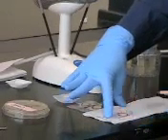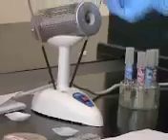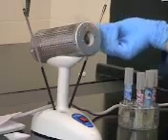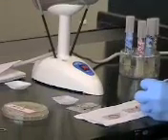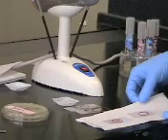Then you're going to want to take your grease pencil and draw a big circle on them. Pretty thick. This will help you find your bacteria once they're stained in the microscope. So your slides look like that now.